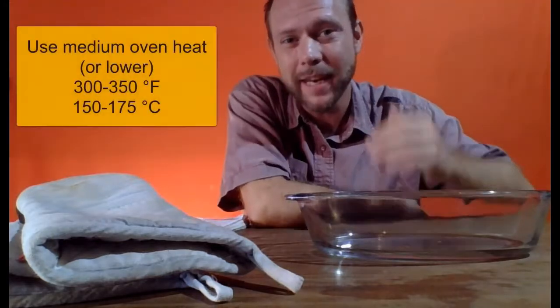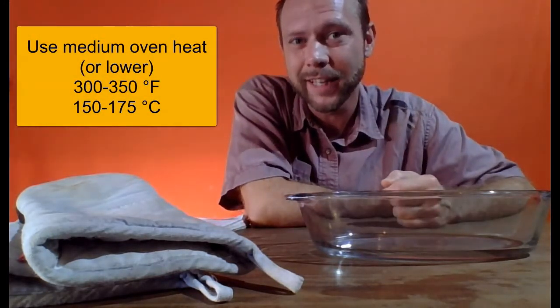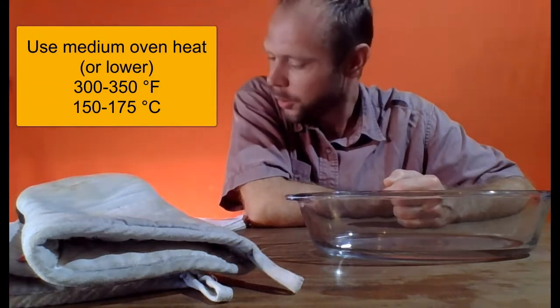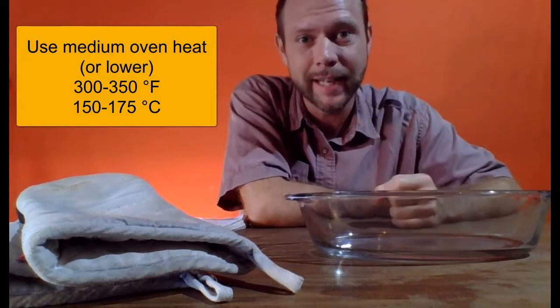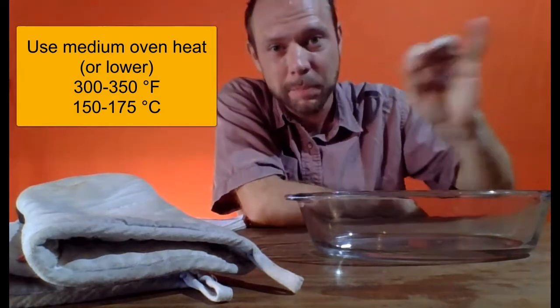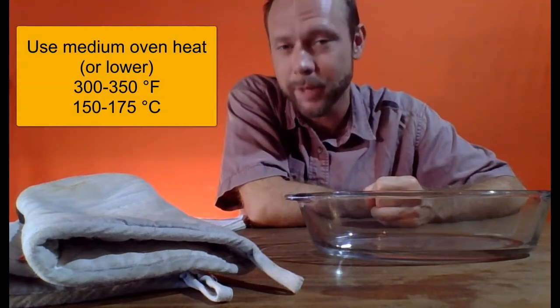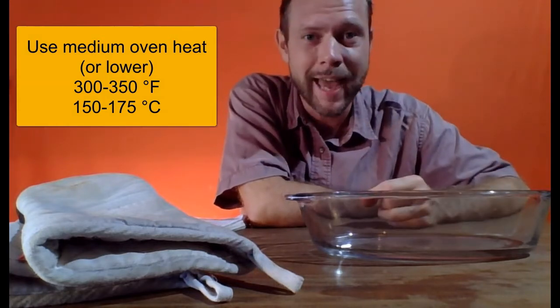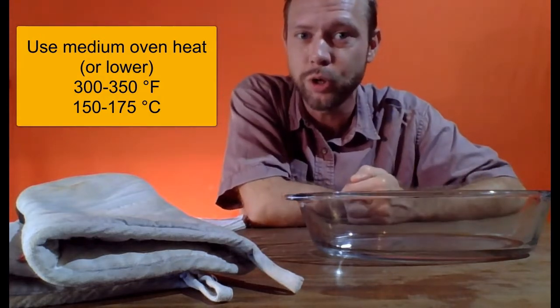And we want to stay on medium heat, maybe even the low end of medium heat. Again, that's maybe like 300 to 350 on the Fahrenheit scale, 150 to 175 on the Celsius scale. Now, it's possible you actually have an oven thermometer to put in and monitor this temperature. It's not important to have a precise temperature measurement. It's just that we don't want to get too hot.